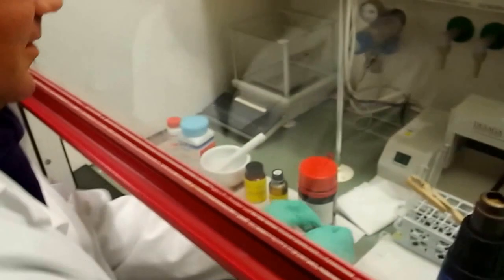So, looks good so far. Switch off the light, and let's see how they perform under UV light. Michael, you excited? I am. Yeah, me too. Alright. Open the stage for the cadmium sulfide nanoparticles under UV light. Come on. Yeah, nice. You see the deep blue luminescence, like violet style.